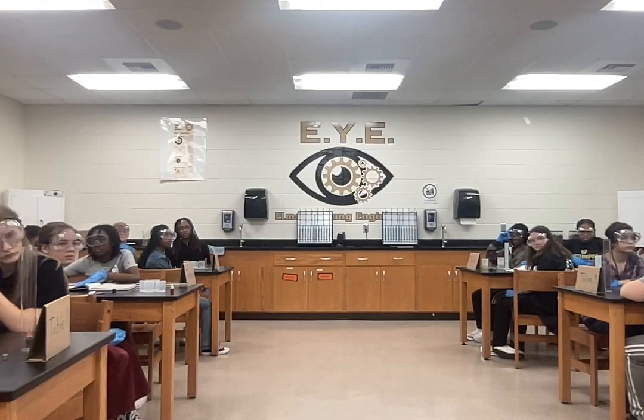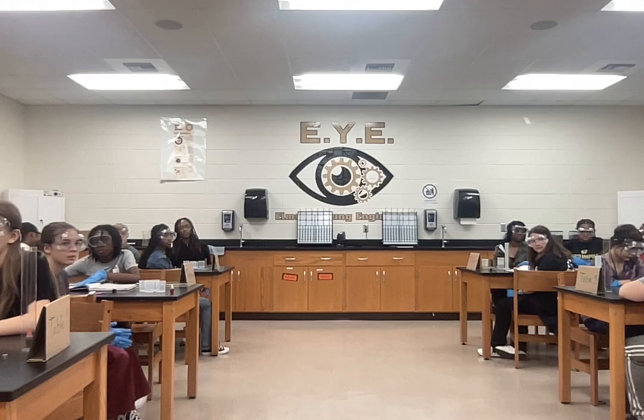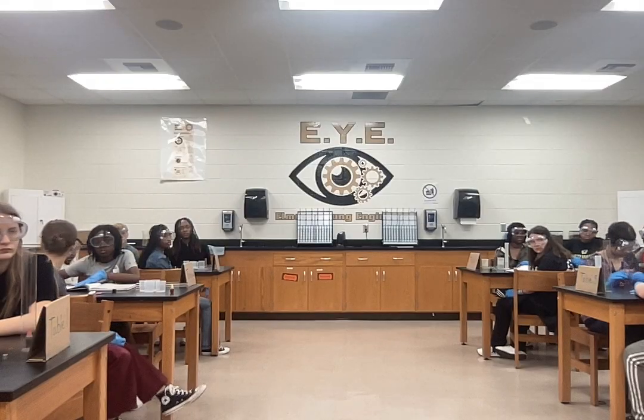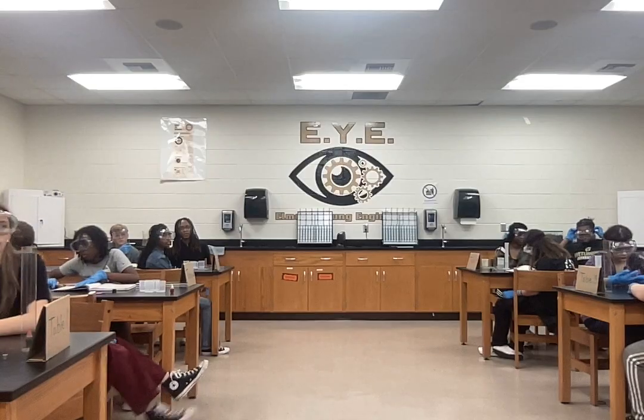So 6 from 14 will give us 8. 8 from 13 is 5. All right, so we get 39.58. And if we have to double check our work, you just add back in the mass of the graduated cylinder.